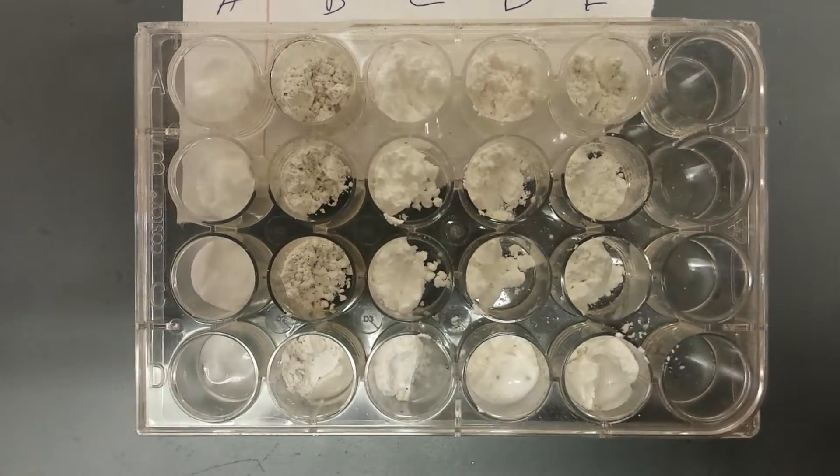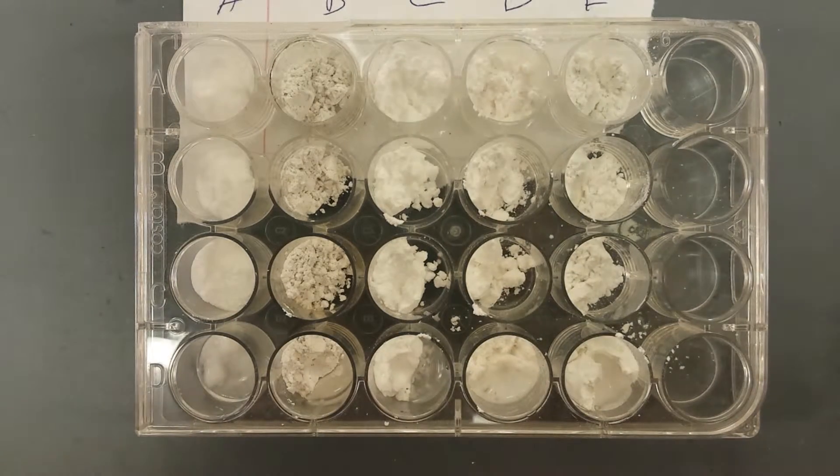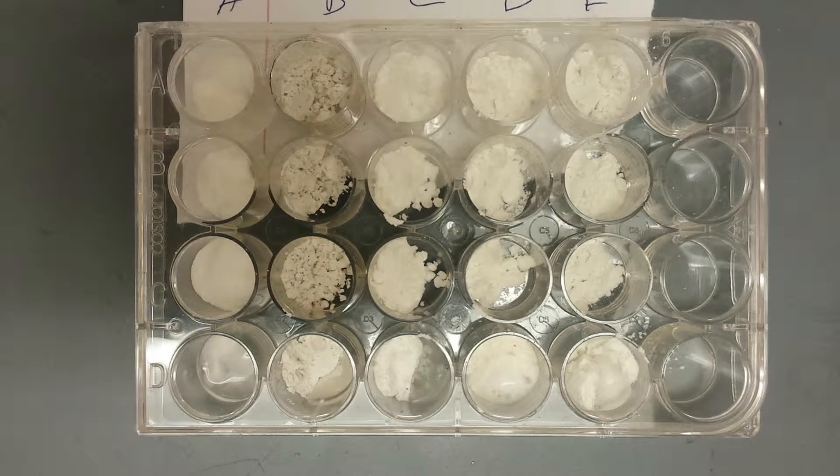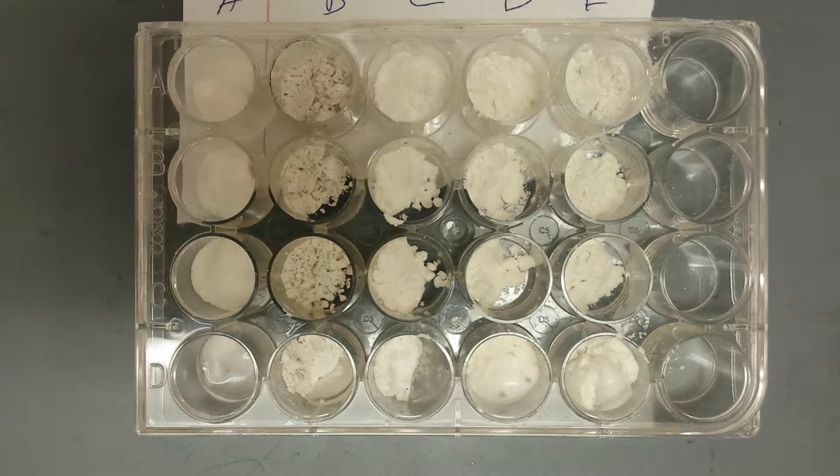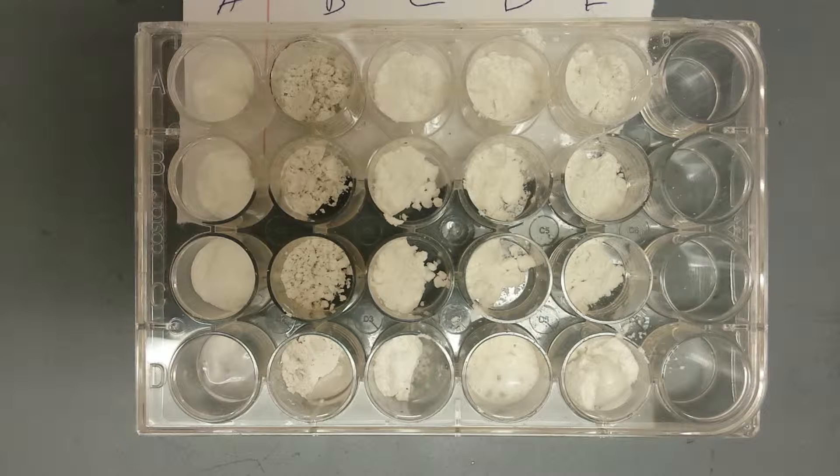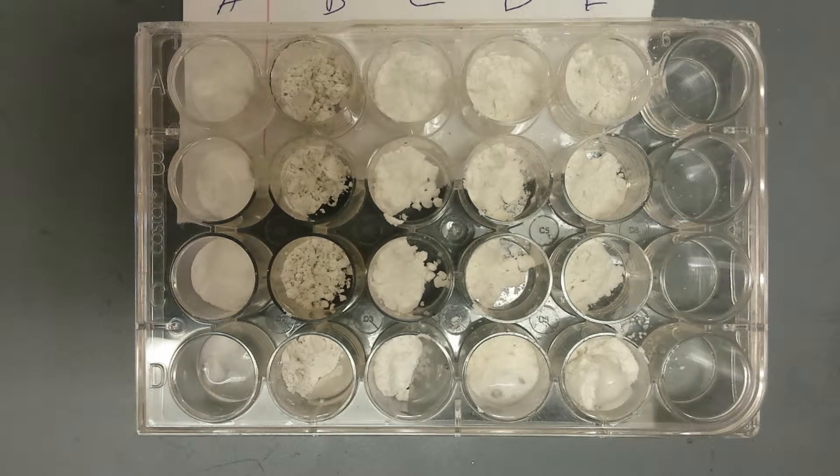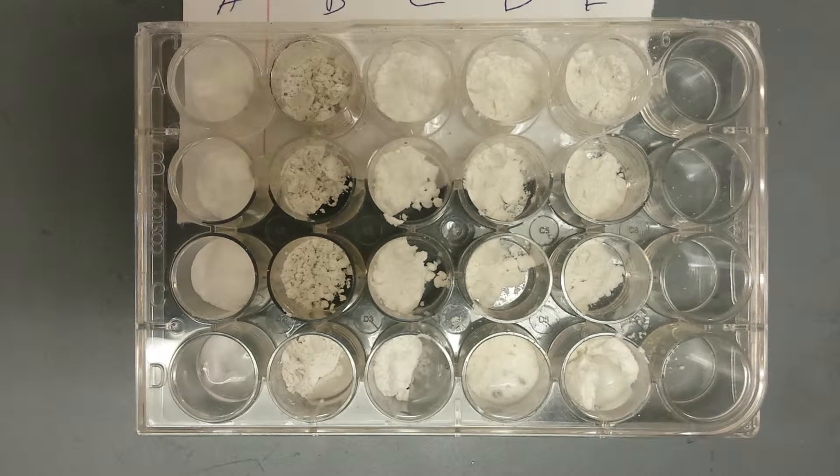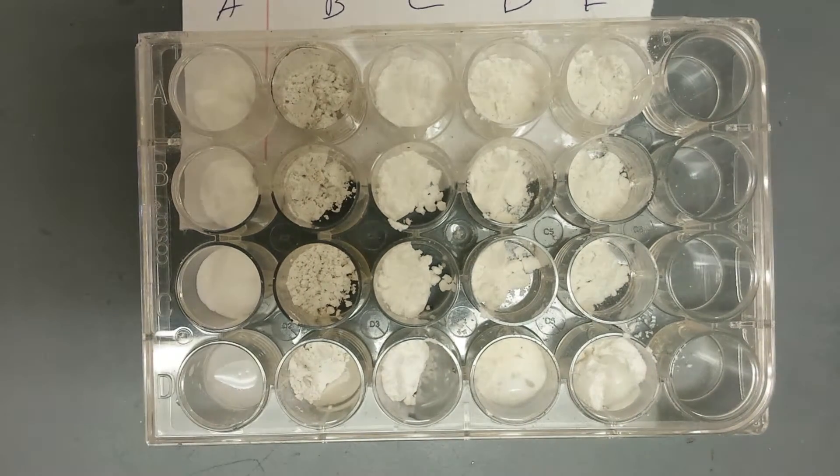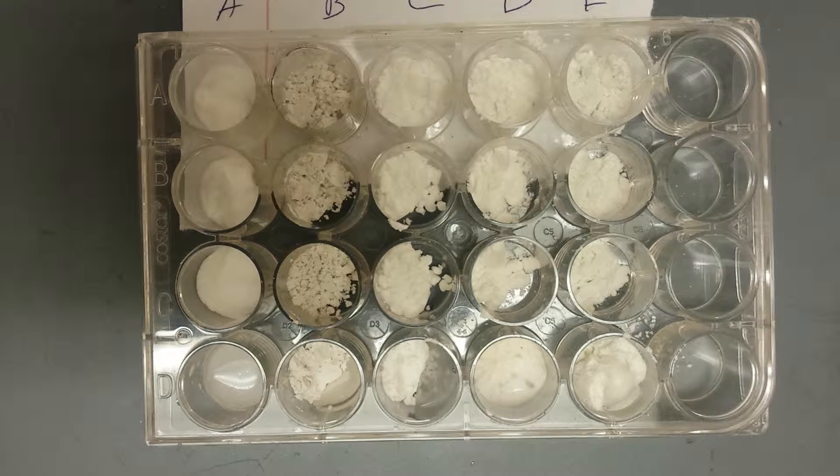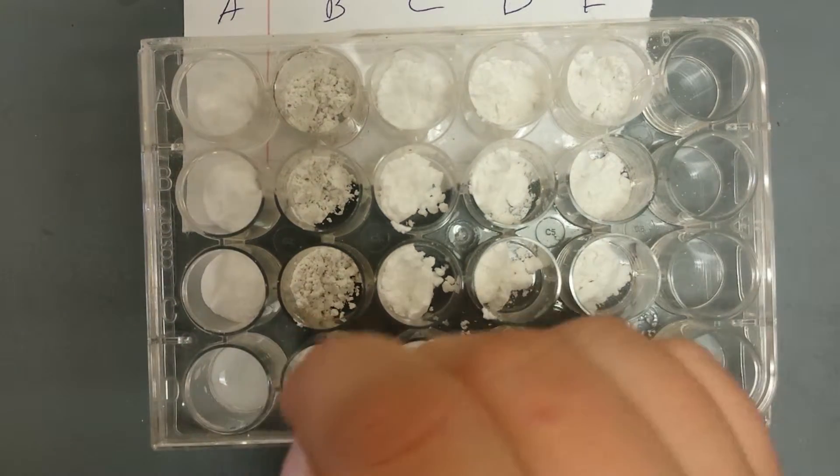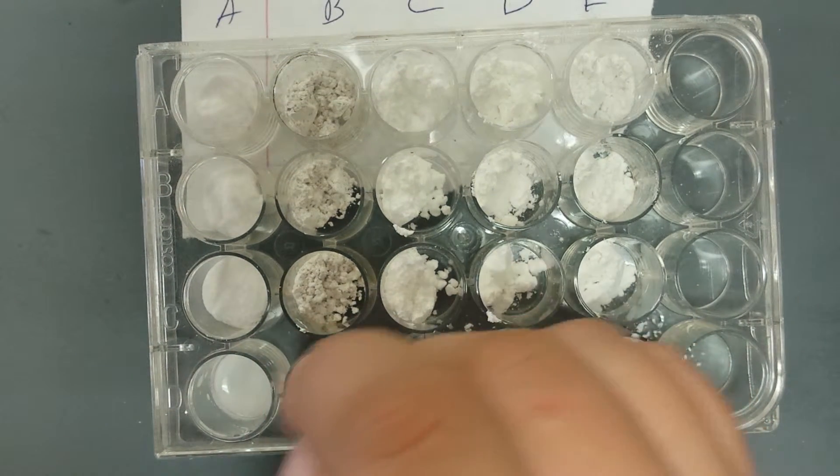D fizzes and bubbles. Okay, the rest of them just like turn a milky color, don't they? One almost... if we use this we'll just use this to stir it, but we're not because then we have to wash it off every time. Can we stir it? We'll just stir it and wash it off every time. It doesn't really do much.